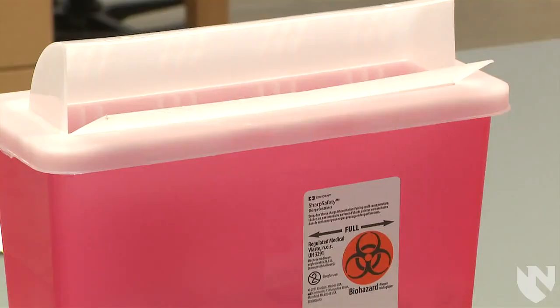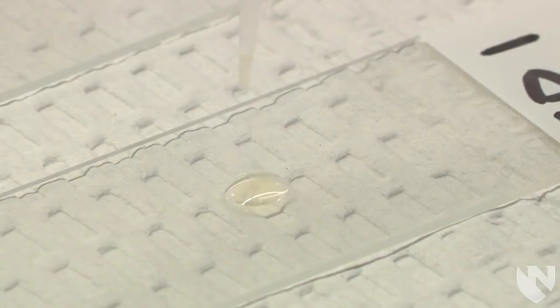If you have any bubbles, discard the slide into a sharps container and make a new slide.